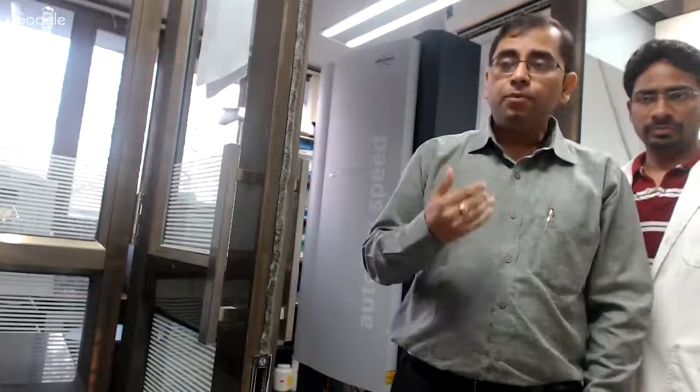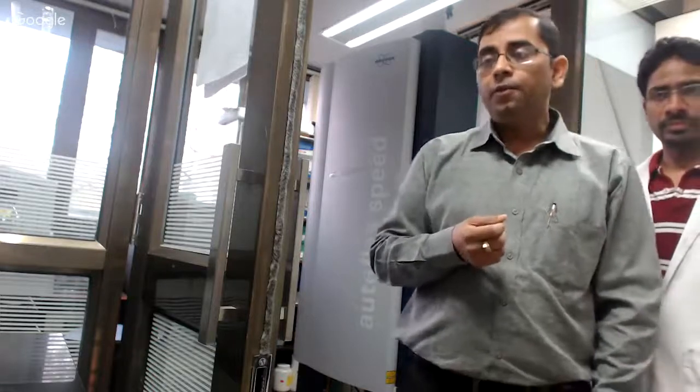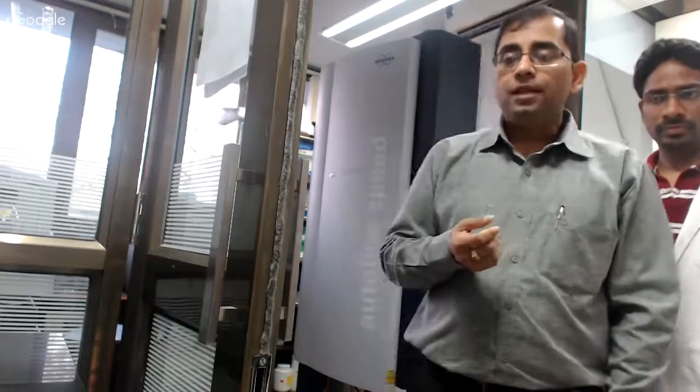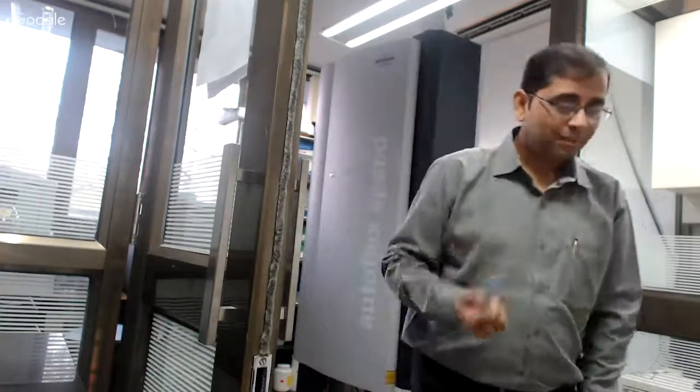So again, in the spirit of you becoming much more comfortable with proteomics technologies and what you can get out of them, we are planning certain hands-on sessions and live demonstrations each week. I'm sure many of you will be able to make good use of them. So please, let me continue the session with Dr. Aishwarya and Vipin, to take you through the actual workflow of doing MALDI-TOF based sample analysis, and after that we can take more of your queries and comments. So let me thank you here, and then I will hand over to Dr. Aishwarya. Please.